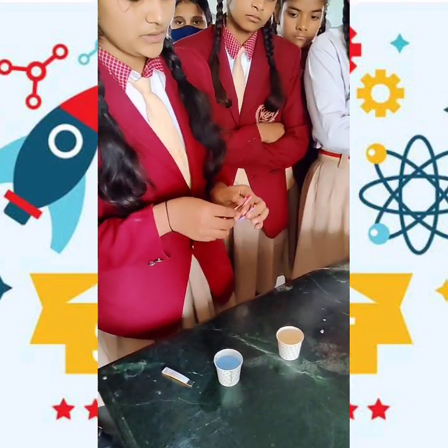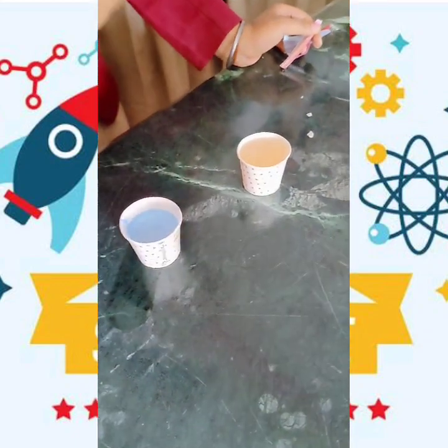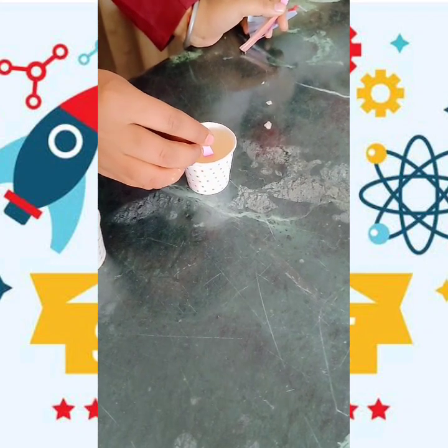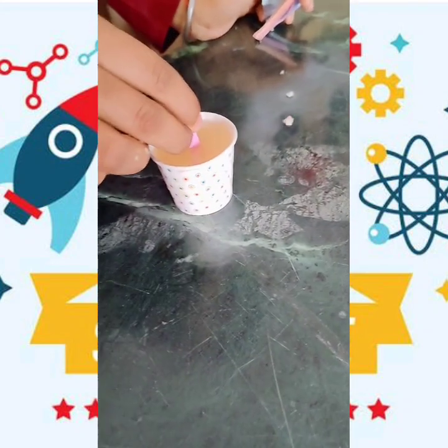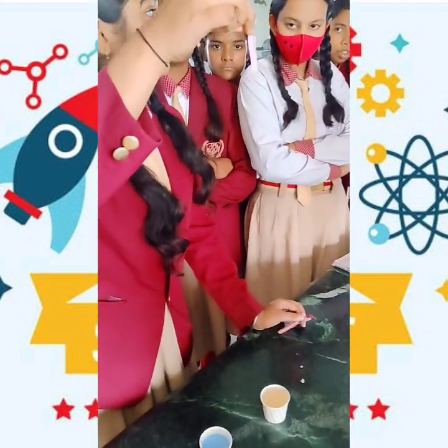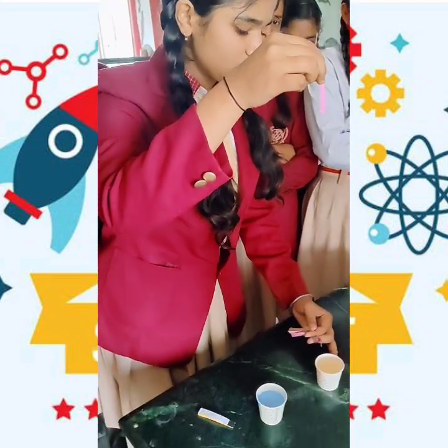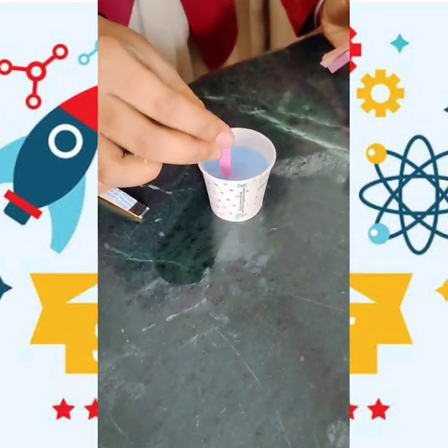So one by one, we will check out what happens. This is the red litmus paper. First of all, we will put this red litmus paper in the solution of the acid — lemon. Now you all can see that there is no change when we put the red litmus paper in the lemon and water acid solution. Now we can put this red litmus paper in the solution of the bases.